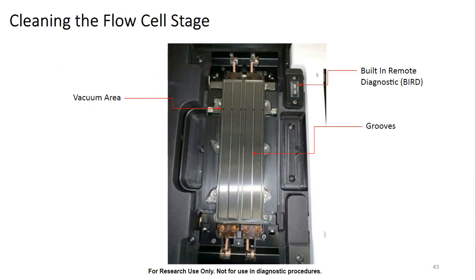So when we talk about cleaning the flow cell stage, we wanted to provide an image of the flow cell stage. And what we're really going to want to do is make sure that we are cleaning off this entire vacuum area surface, as well as paying special attention to cleaning out the grooves on the flow cell stage to make sure that there's no debris stuck in those grooves. You'll also note that we have the built-in remote diagnostic, or the BIRD, and this is something that we can also wipe off with an ethanol wipe very carefully to help make sure that we get a good read off of that.